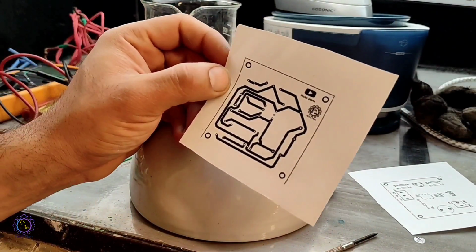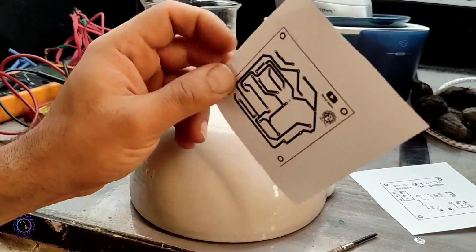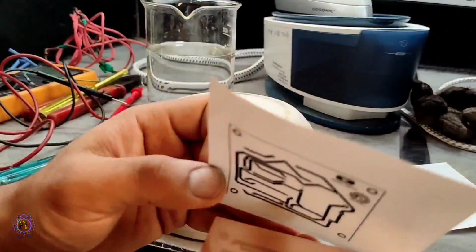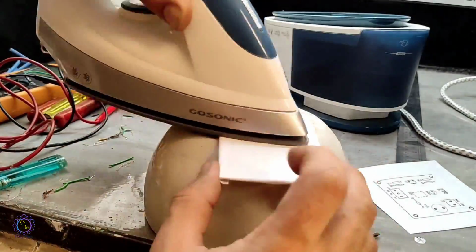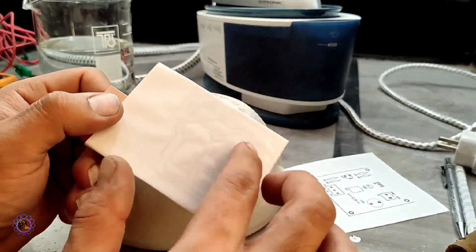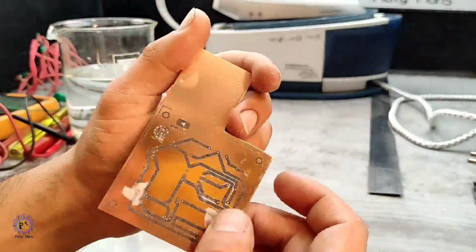I started with designing a short circuit protection for a module that I want to use to control output power of a constant power supply. I printed my design on a glossy paper, and after transferring the toner with the iron method, I started etching my PCB design with ferric chloride solution after peeling the paper.